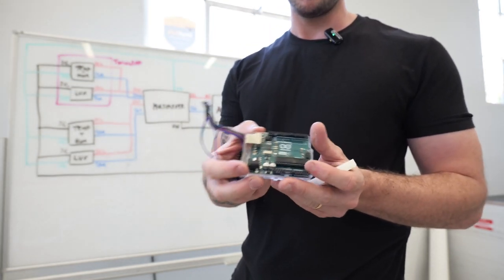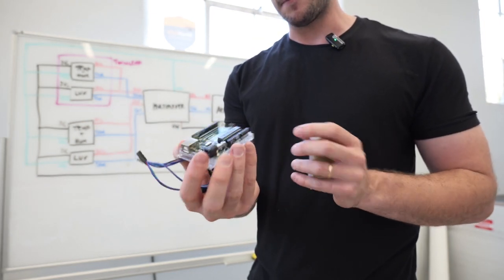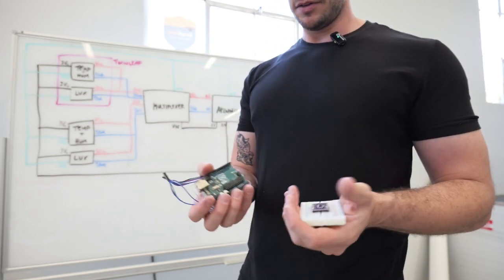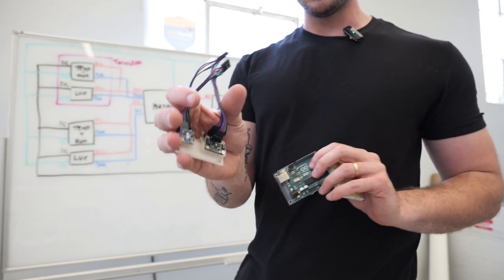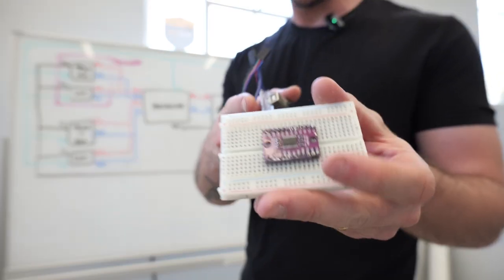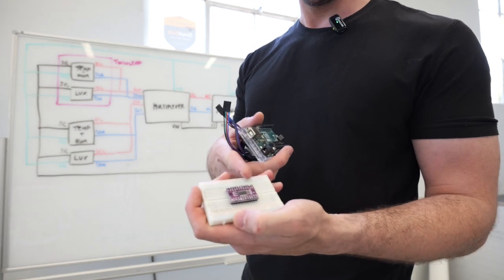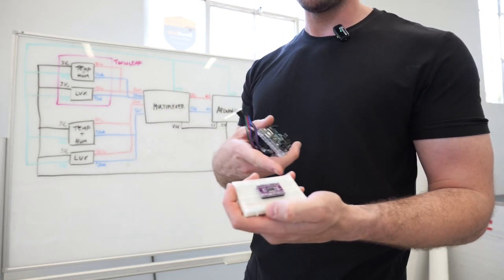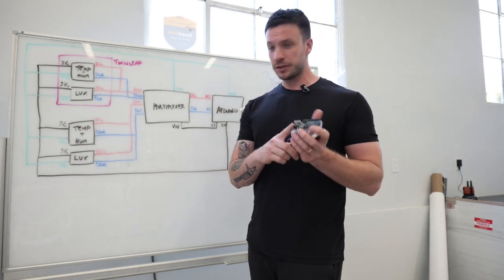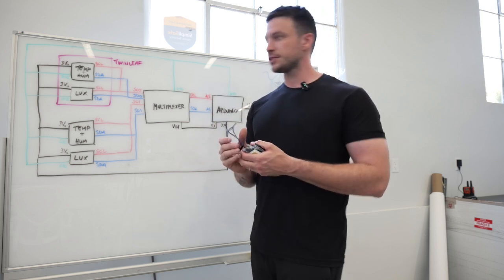And then I have an Arduino, so a microcontroller, and I'm gonna use these basically to read out from the sensors. And in order to connect these sensors to the Arduino, I need another piece, which is the multiplexer. And basically this allows to connect multiple sensors which have the same address to a single board, so that I don't need two different Arduinos for the two sets of sensors.